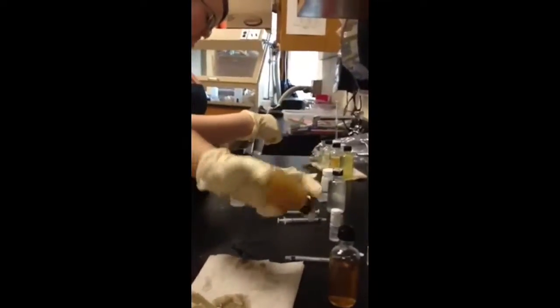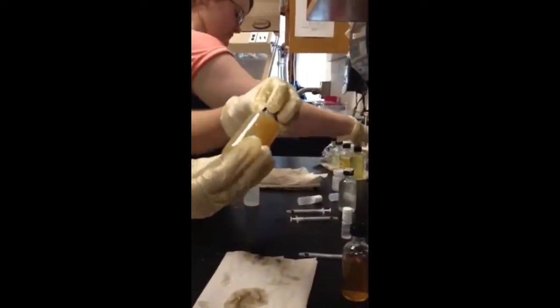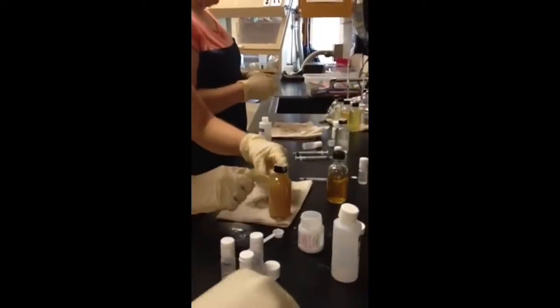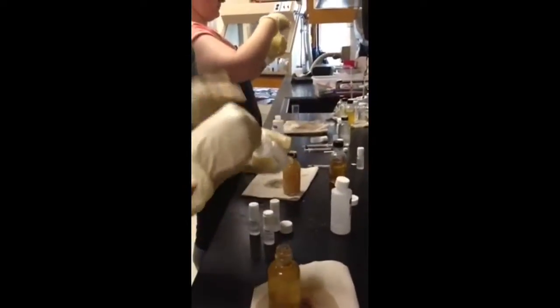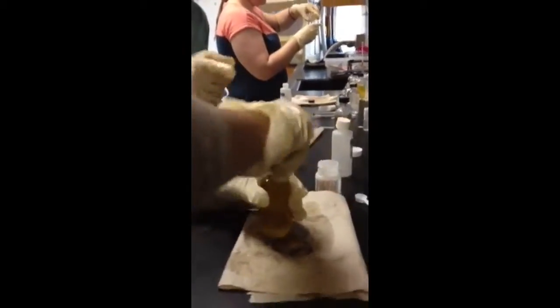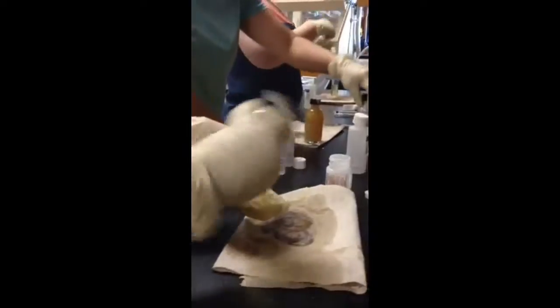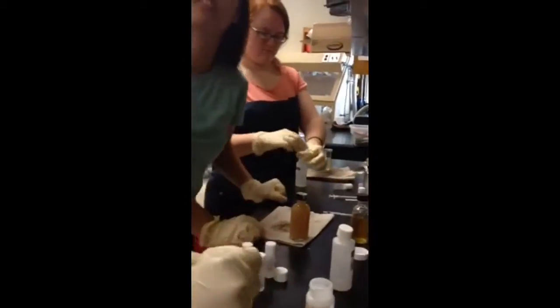so that the whole bottle gets this kind of cloudy color, and then you let that sit until this cloudy stuff settles down to be below the shoulder. And then you add sulfate like Toledo is doing, or sulfamic acid, I'm sorry. And that turns this cloudy stuff into a more clear color, which you can see in there, or it turns into something like this, depending on the concentration levels.